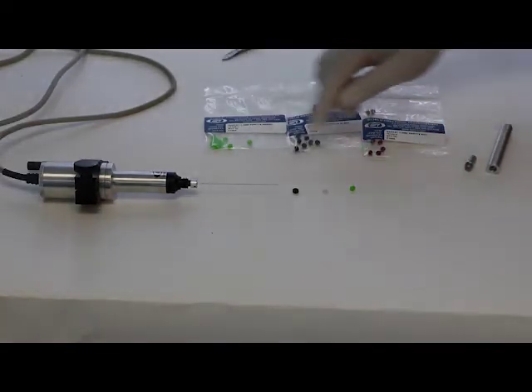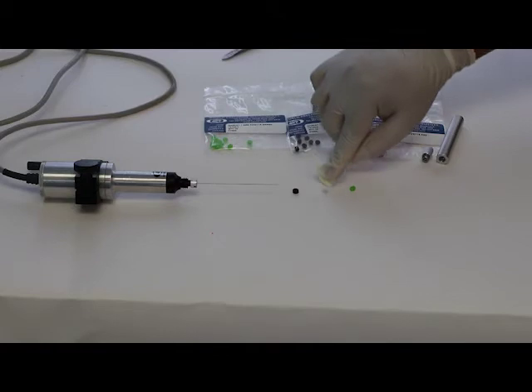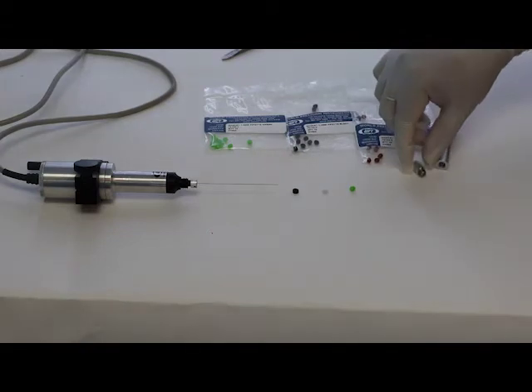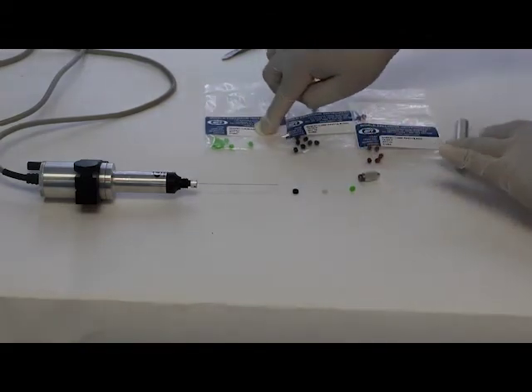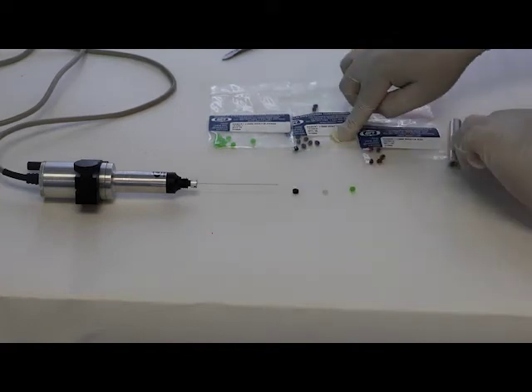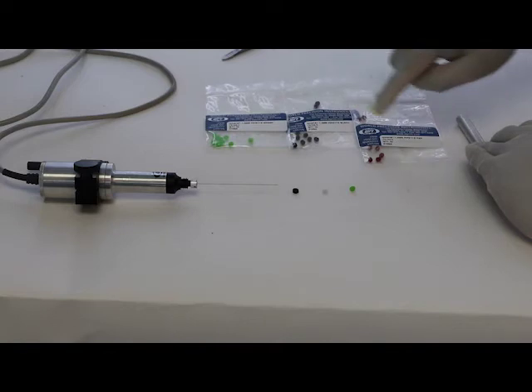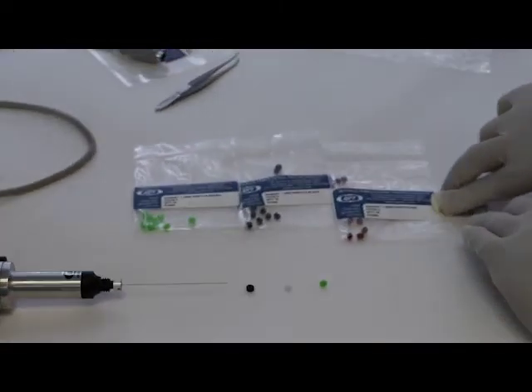The first gasket that we show is the black one. That's a seal gasket. The second one is a spacer that you're going to have to watch out on the orientation when you put it in. And the third one is for the glass capillary. And you get these different ones, so you can use according to the OD of the glass that you're using. You actually get three, one for one millimeter glass, one for 1.2 glass, one for 1.5 glass, and also for 1.14 glass.